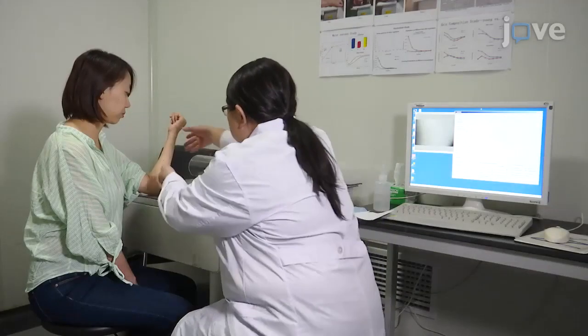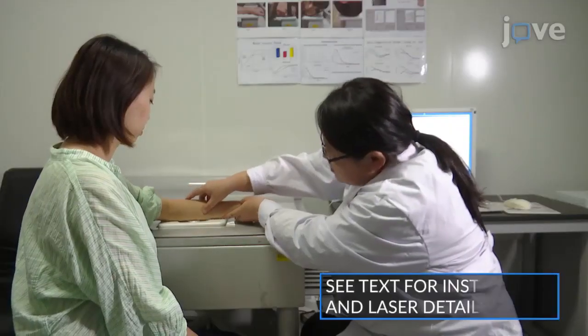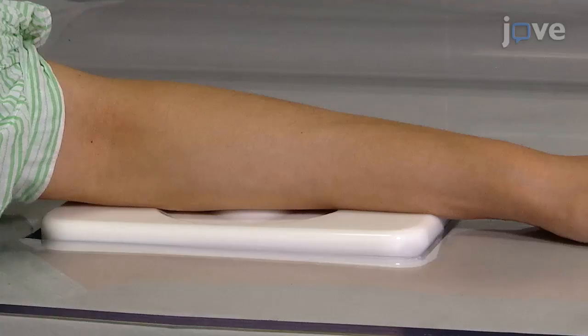To begin, have the subject place a marked lesion body site or control site in close contact with the imaging window of the in vivo confocal Raman instrument. Be sure that they cover the whole window to avoid the impact of room light on imaging.